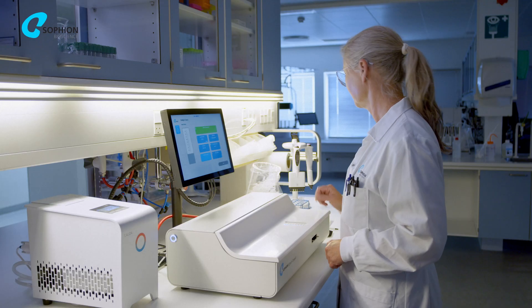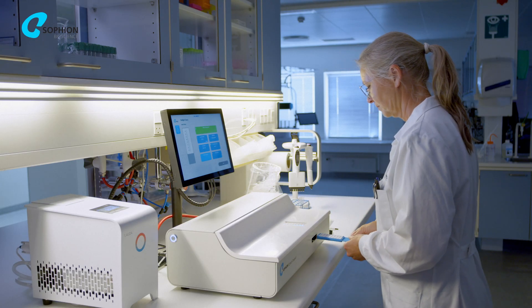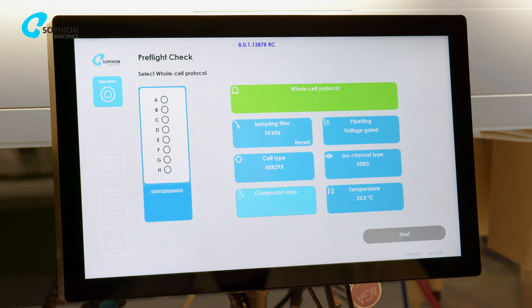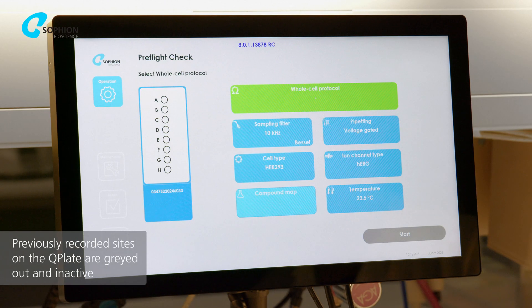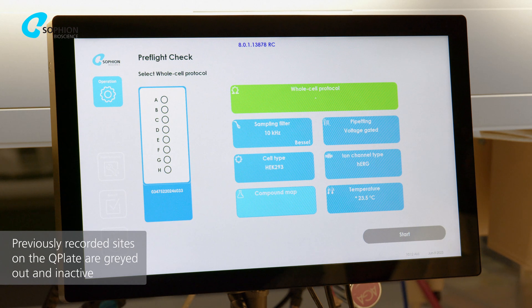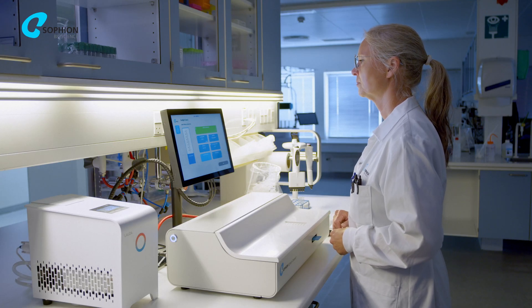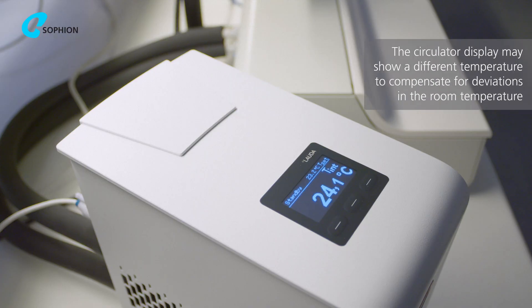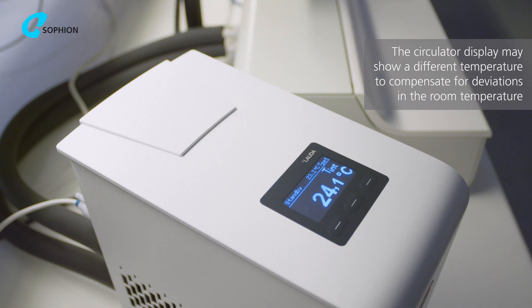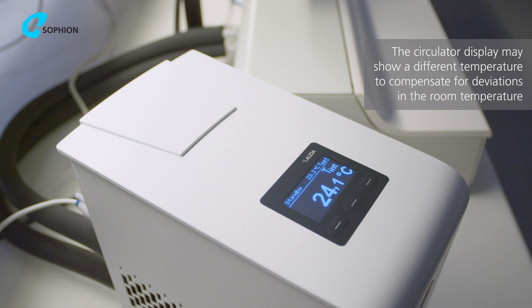Gently push the Q-Plate into the slot on Qpatch Compact. The Q-Plate pictogram is activated and the screen will now state the barcode. To achieve the correct temperature on the Q-Plate, we recommend preheating the instrument with the Q-Plate for one hour before performing your experiment.